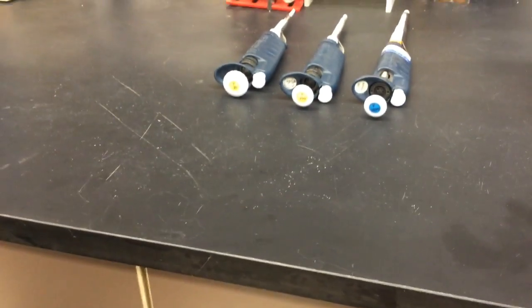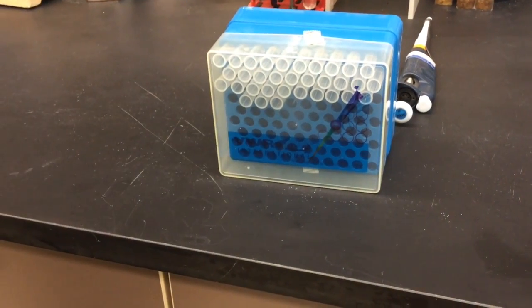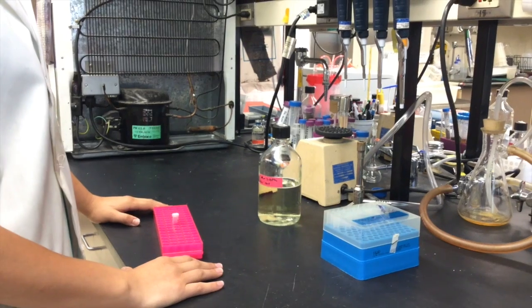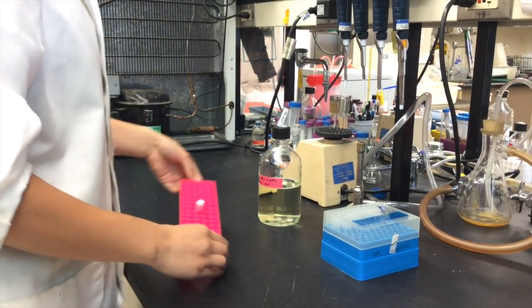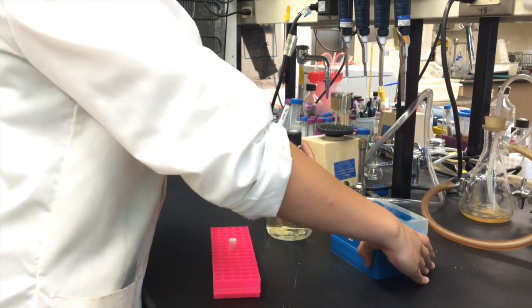We use these instruments in conjunction with disposable and often sterile tips. For our purposes today, we will be using sterile tips. First, gather all the equipment and supplies needed. Make sure your workspace is clean and organized before beginning.